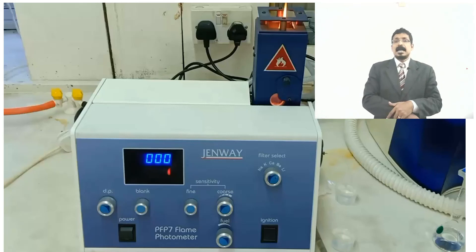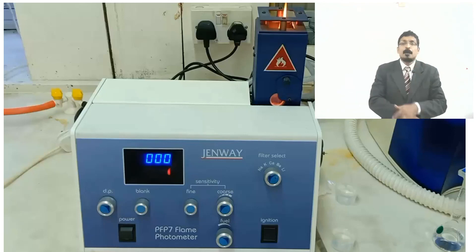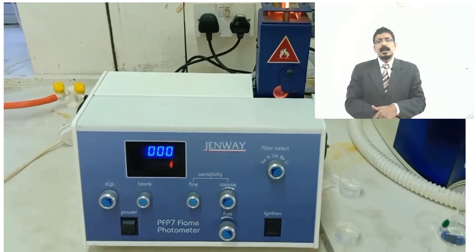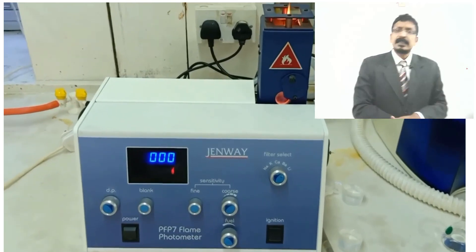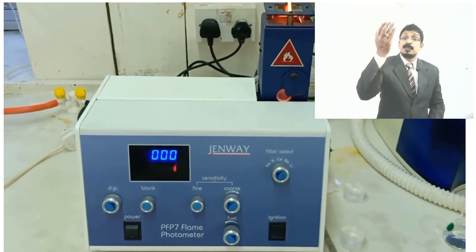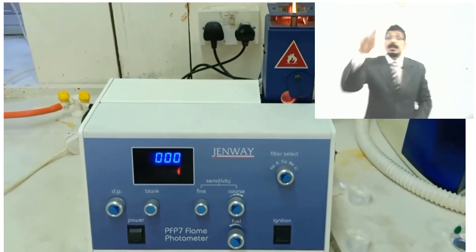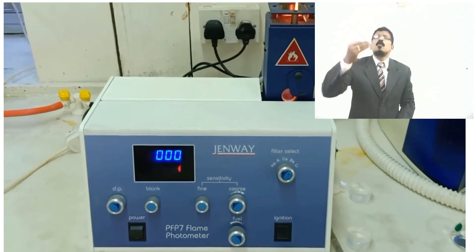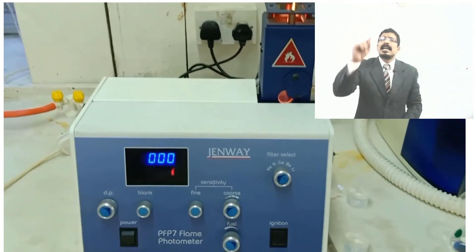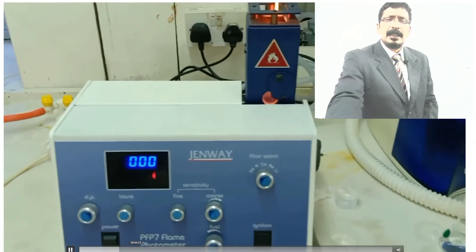How to connect the LPG gas, how to prepare dilutions of your standard solution — these are very important parts of flame photometry. In this instrument, you can see the flame should not be yellow and high; from the lens you can observe an M-shaped or zigzag blue flame very clearly. The first step is to prepare the standard flask with a stock solution and then make the required dilutions.